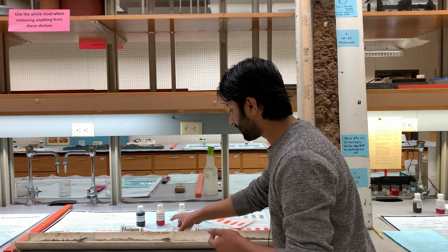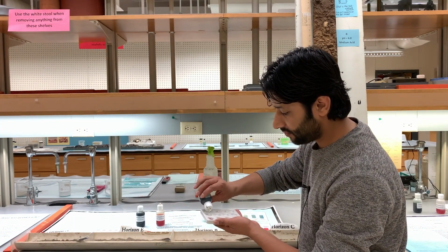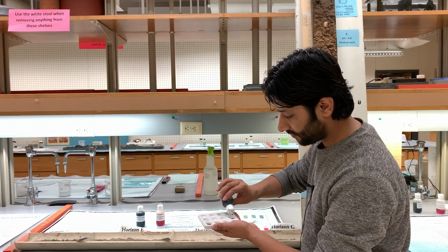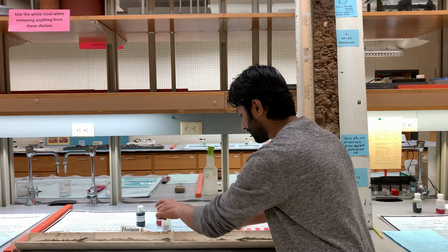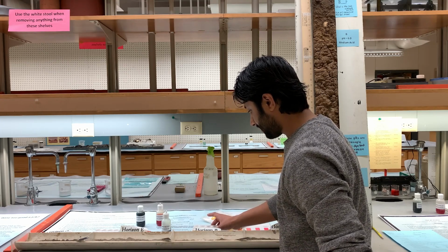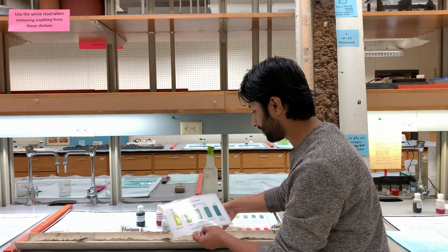I will show you, since we are out of the limit for the red dye, we will try to use the blue because we will move toward more basic ones. You just add a small amount of the dye to your soil, so that it will just cover it up, and then you swirl this for a few seconds. And then based on the colors, you can again determine the pH.